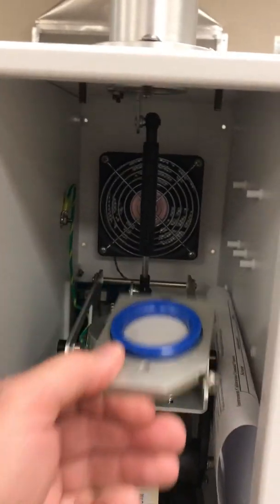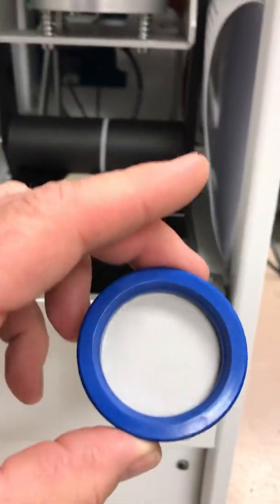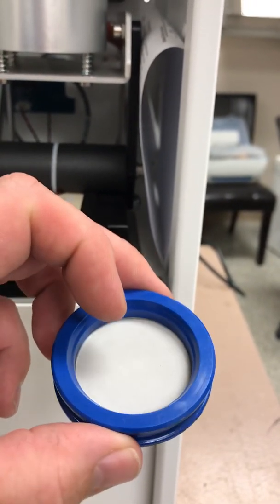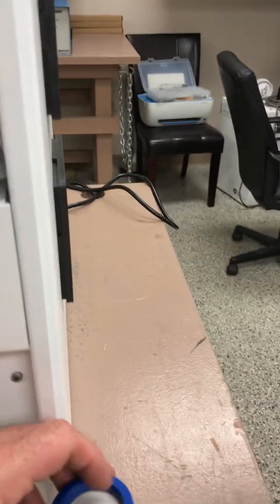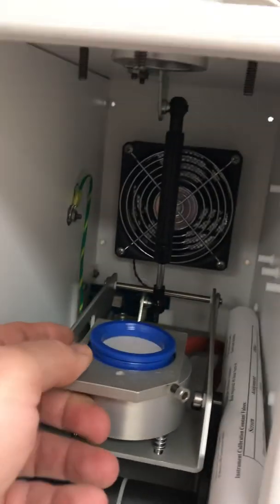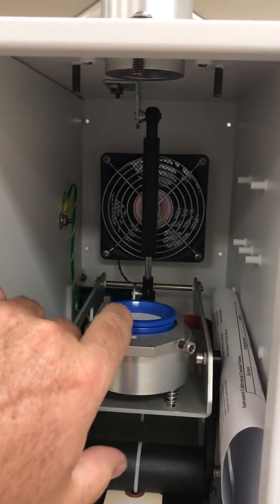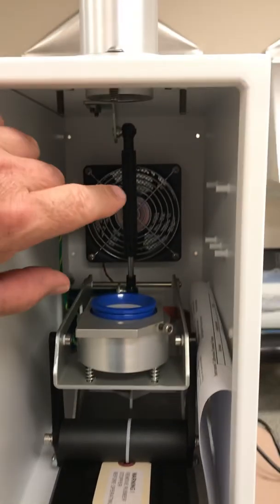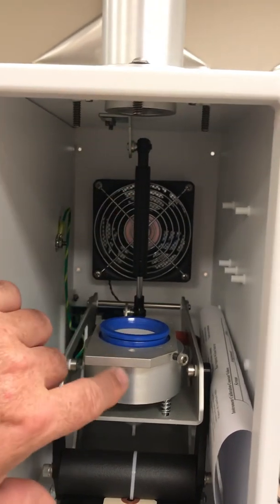This filter cassette is where everything happens. It works on a sample filter that's pre-weighed on a microbalance. Once the pre-weighing is done, it's sent to the field and the technician will install it — it's already pre-packaged in this cassette at the lab. The field tech will simply put it in this plate, load it into the cartridge holder like so, then close it up. There's a mechanism that will close onto the mast assembly. There's a pump in the bottom of the cabinet that will run a midnight-to-midnight 24-hour sample, collecting particulate down onto this filter.